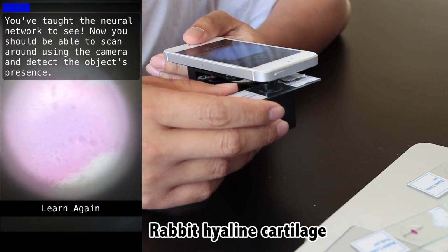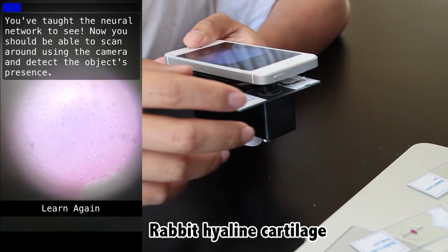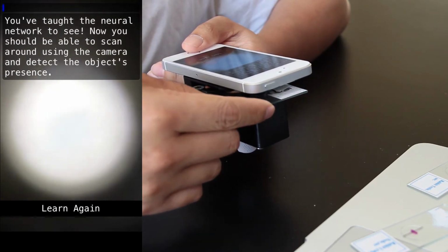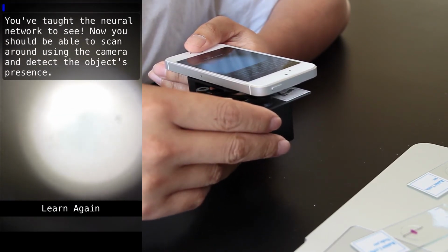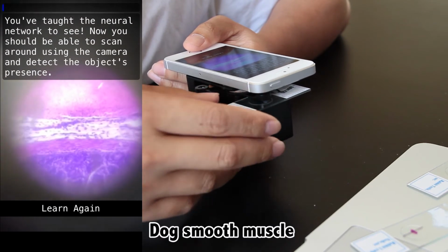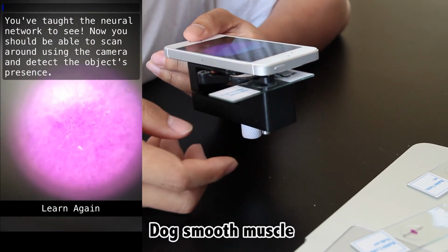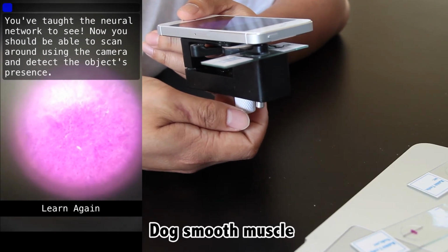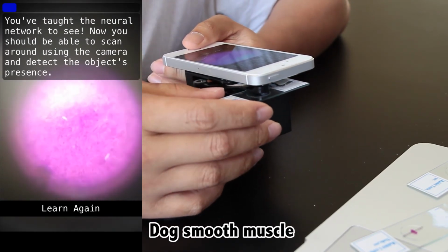As you can see, it's doing pretty well. And even though frog liver was kind of an easy example relative to the other slides, and we haven't really tested it very extensively, really this is pretty amazing for something that you can do on your phone. Not too many years ago, we were struggling to get clusters of computers to recognize the difference between the written number 1 and 2, and now we can recognize the difference between microscopic tissue images on a phone.